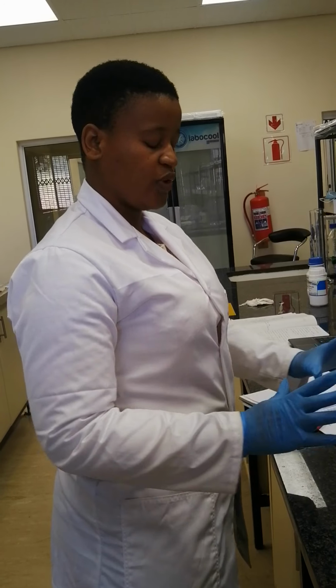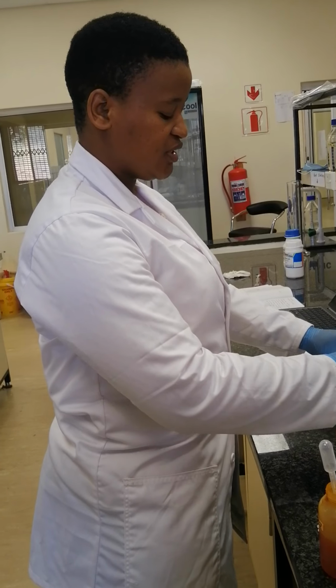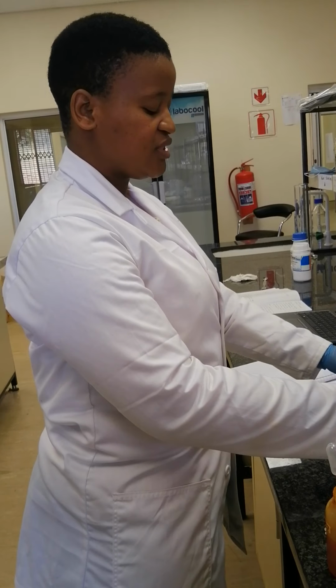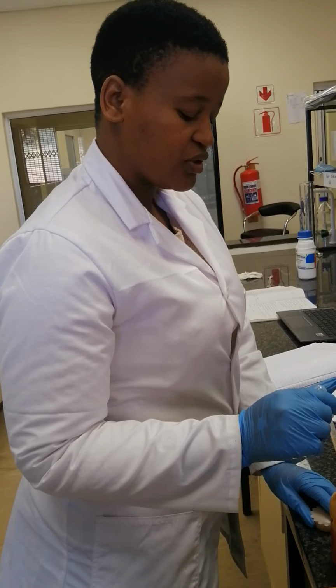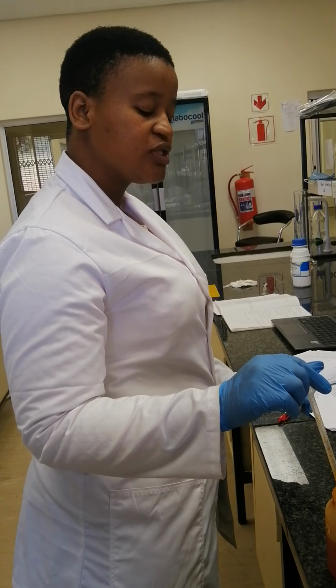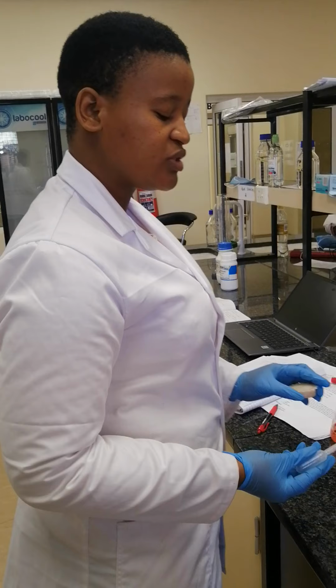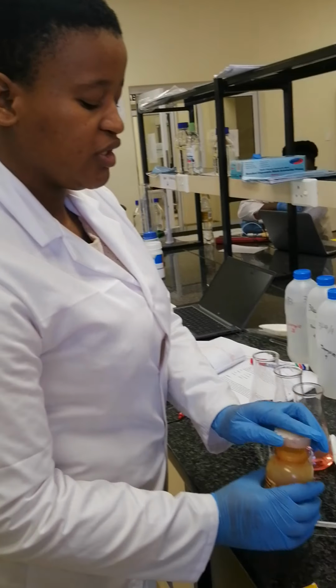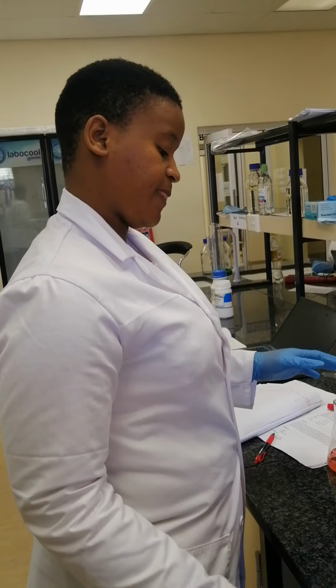So make sure that when you do the calculations for samples above 8.3, you calculate the phenolphthalein alkalinity alone, and you also calculate the total alkalinity alone. But for those below 8.3, you only calculate the total alkalinity. Thank you. Then we'll continue with the acidity and hardness in water.